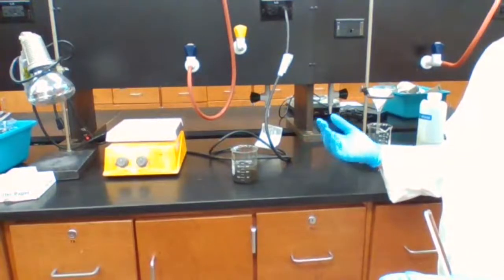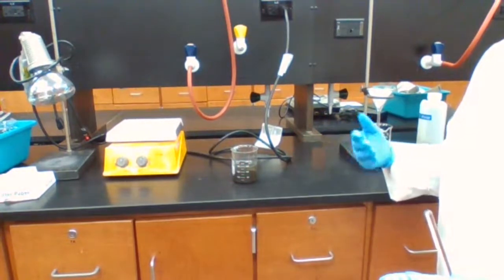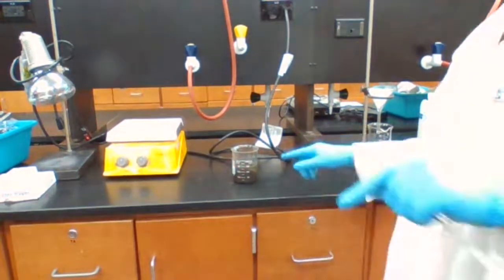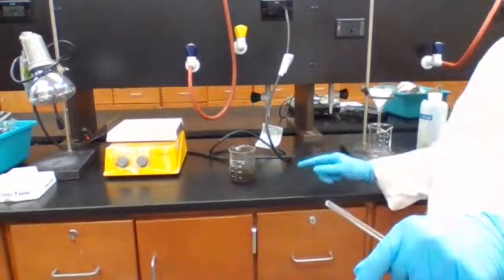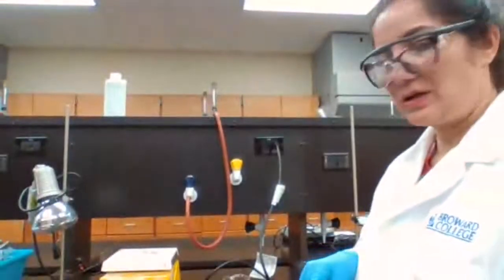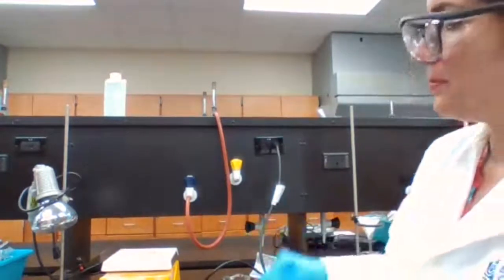So we add the nitric acid to copper. We add sodium hydroxide. So it could be like sodium nitrate left over. We could have extra sodium hydroxide, or any soluble compound that is in this mixture is going to be in the top clear solution. The bottom part, which is more cloudy, is going to contain the copper oxide. And that's what we need for our next step of the reaction. So we only need the copper oxide. So we try to get the top part out.